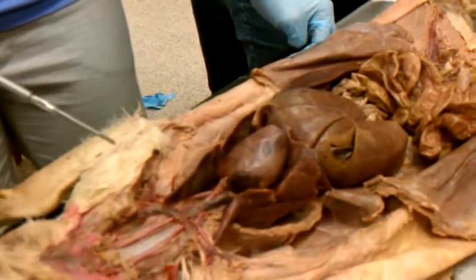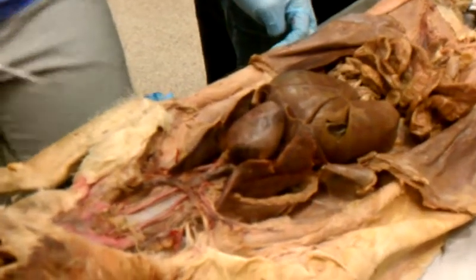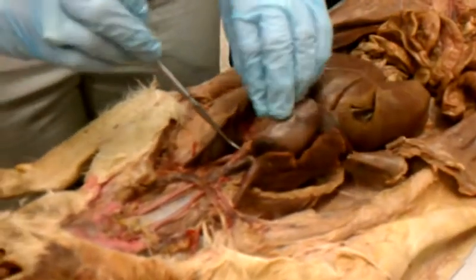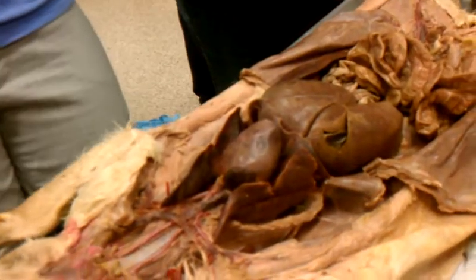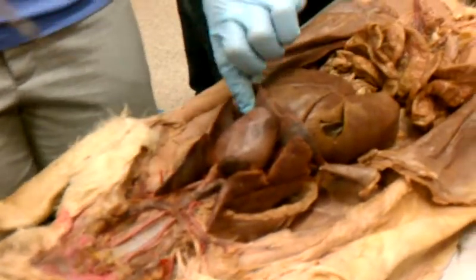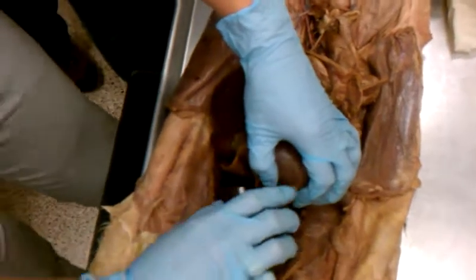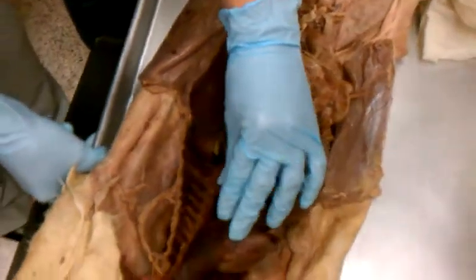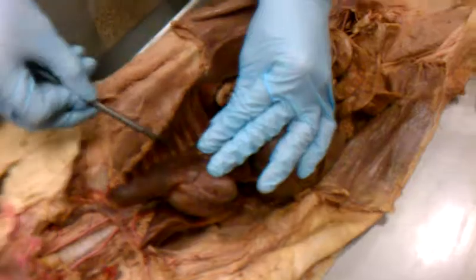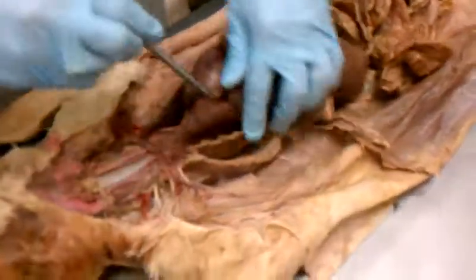And then you have the, let's see. Okay, thoracic aorta. So the aorta goes right here and it goes all the way down. Where is your thoracic cavity? Is it above or below your diaphragm? Above. So if you see this diaphragm right here, and you go above it, and you move these lungs aside, some of you are going to have to flip over. Some of you move around if you need to see it. Here's your thoracic artery. On this side.